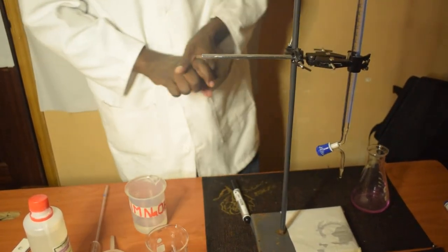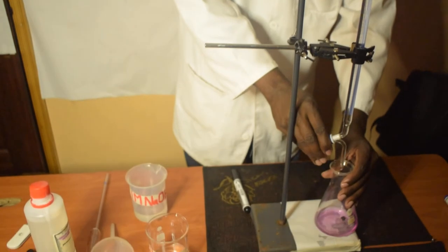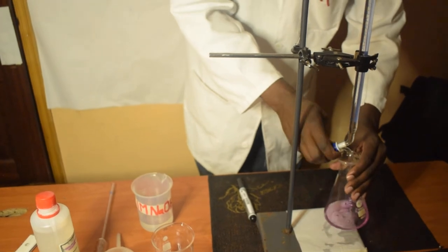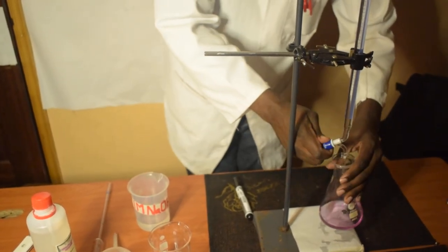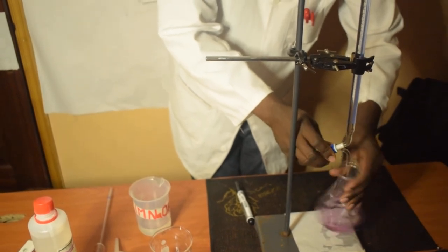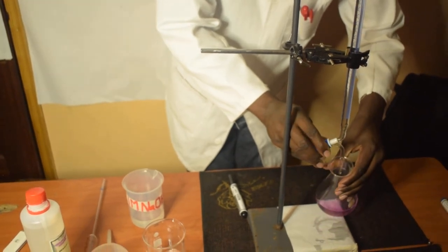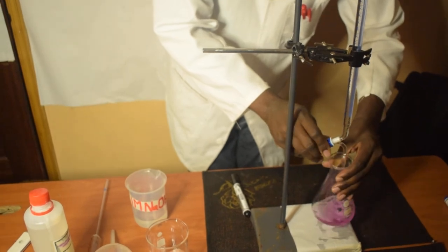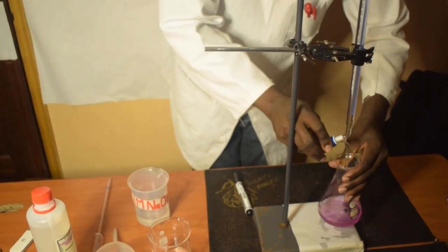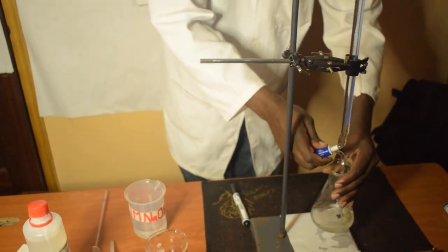From there I'm going to carry out my titration by opening the tap of the burette and allowing the solution to get into the conical flask. As I do this I'm supposed to shake. And there you are.